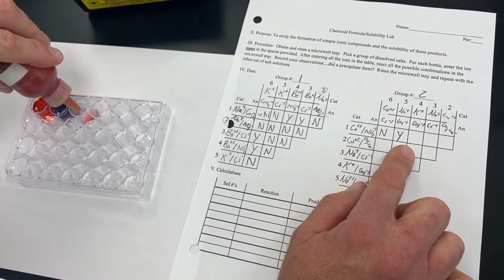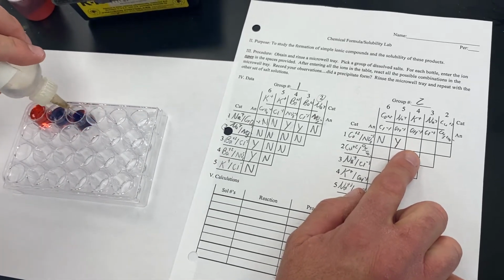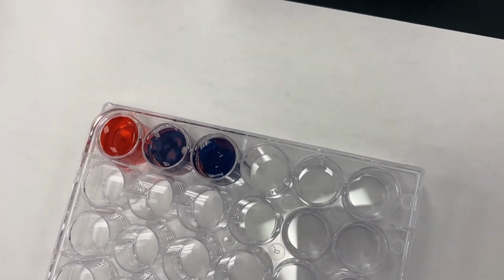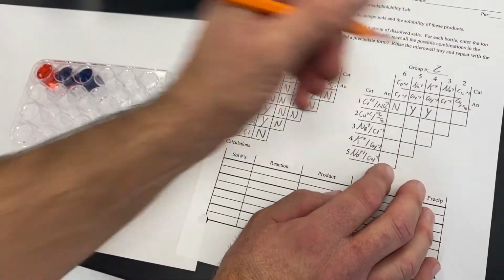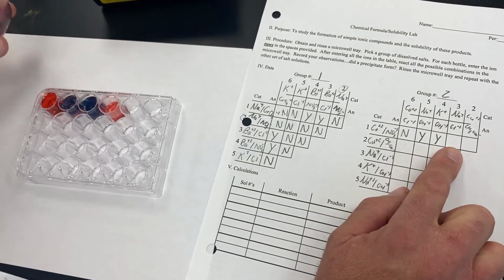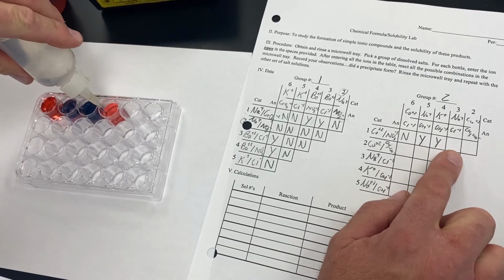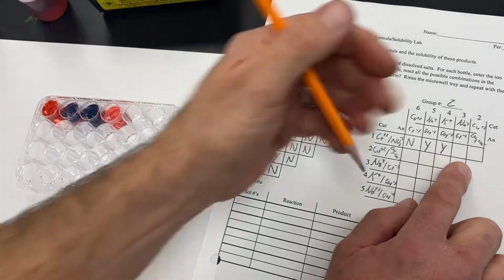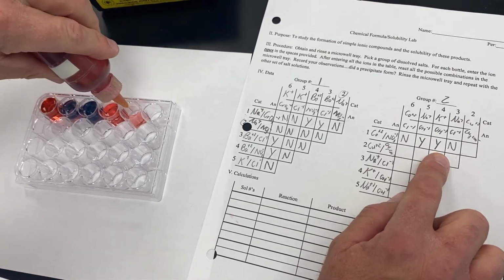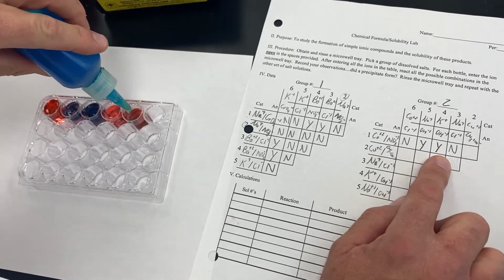Now we come back over here to our cobalt nitrate, and to that we are going to add potassium hydroxide. And you'll notice that our results are similar, that again we got that deep blue purplish precipitate, so that too created a precipitate. Then we're going to come back to our cobalt nitrate, and to the cobalt nitrate we're going to add some sodium chloride. Notice that that remains clear, meaning that it did not precipitate. And then our final combination will be the cobalt nitrate, and to this we will add the copper 2 acetate.